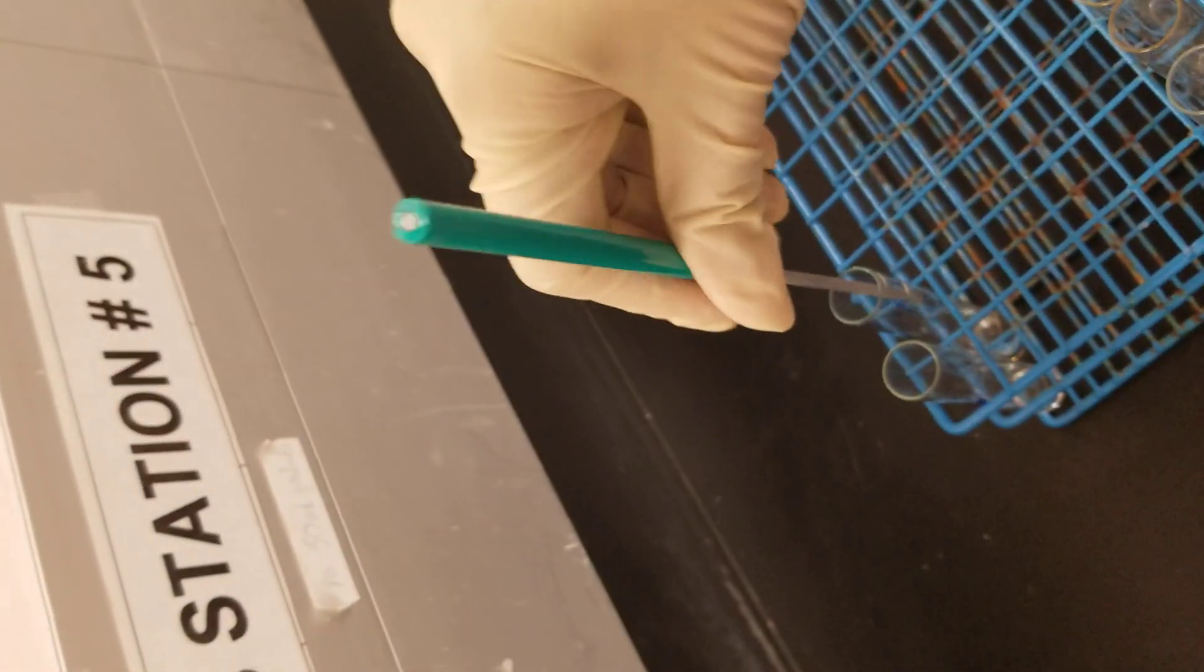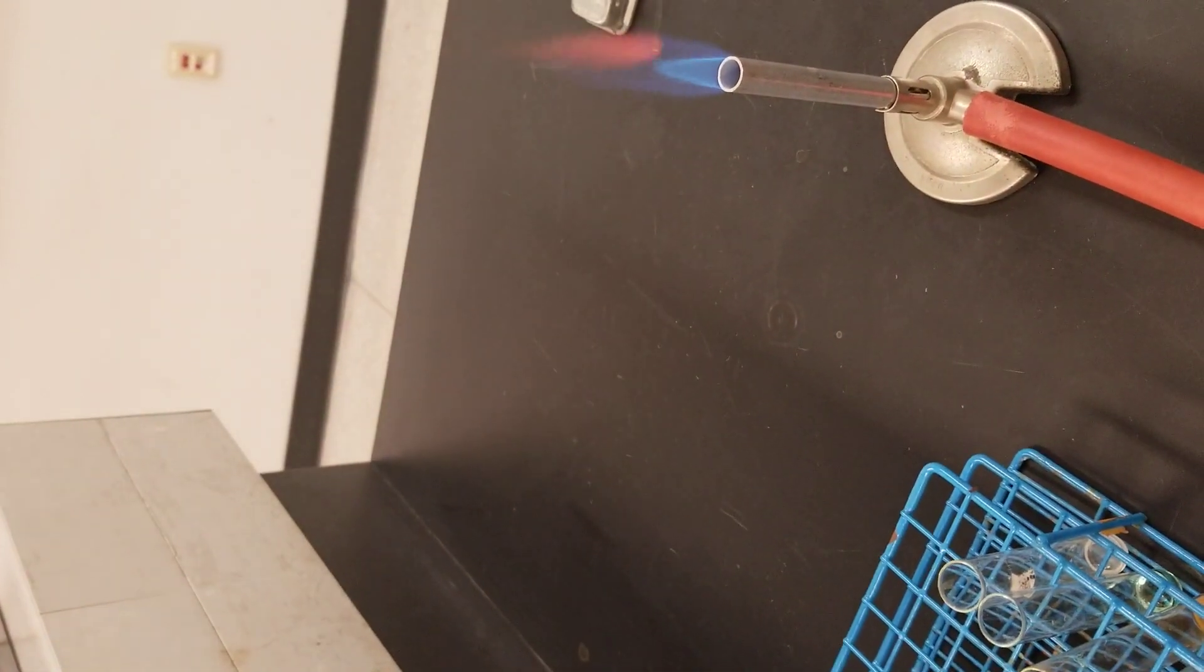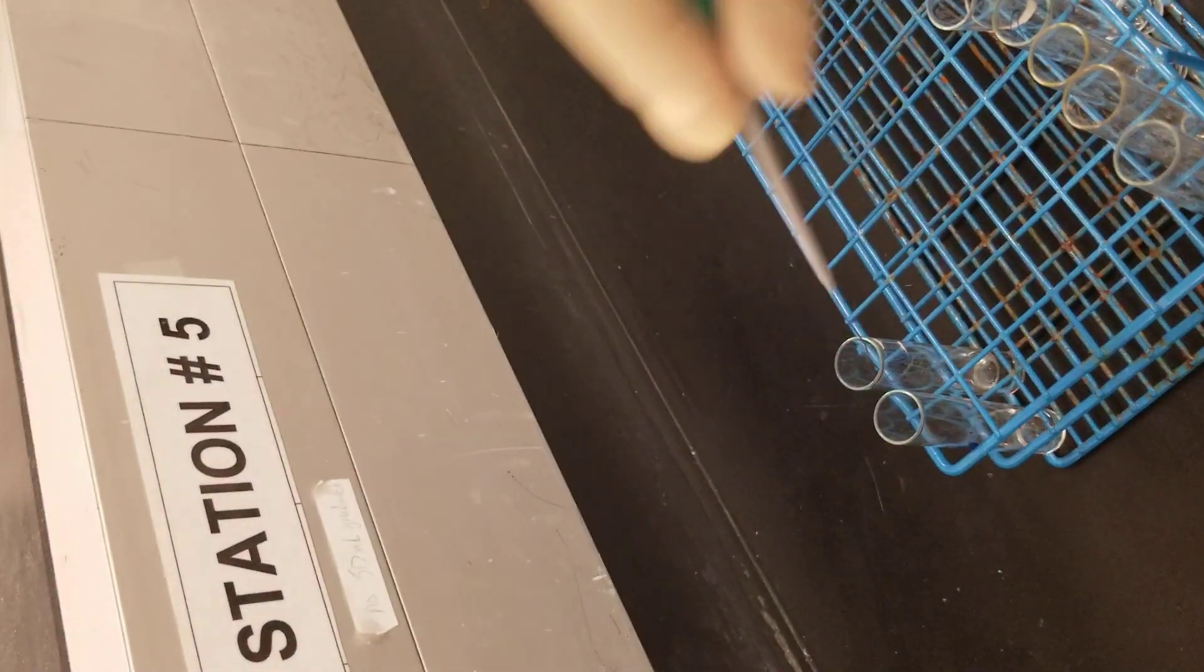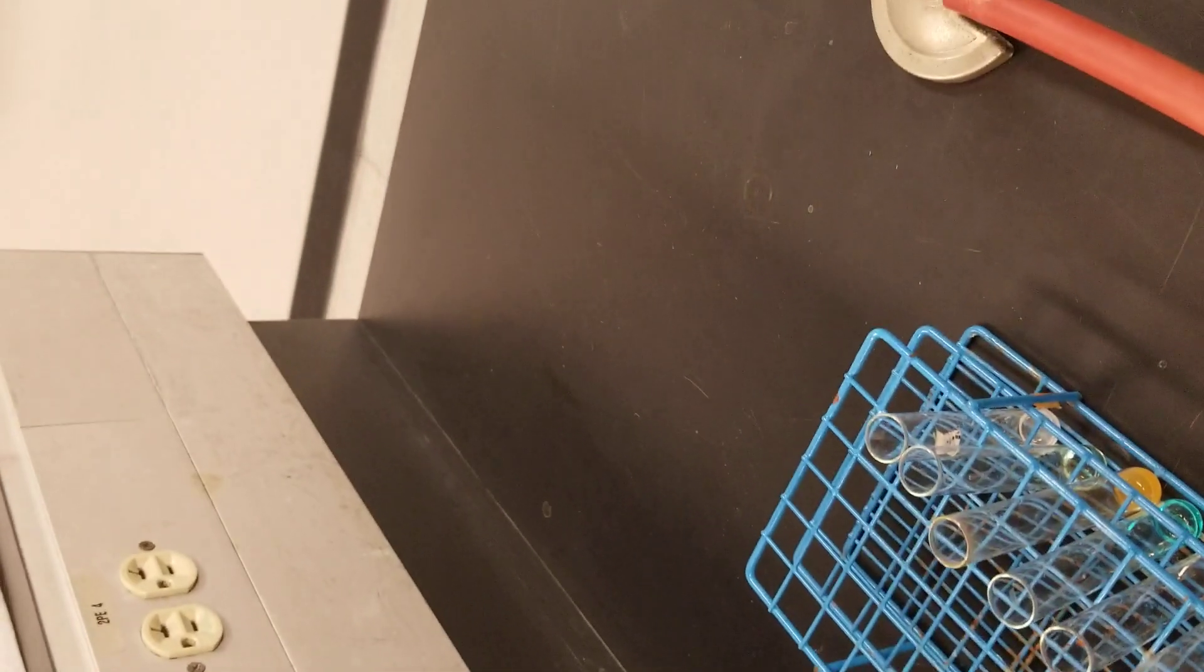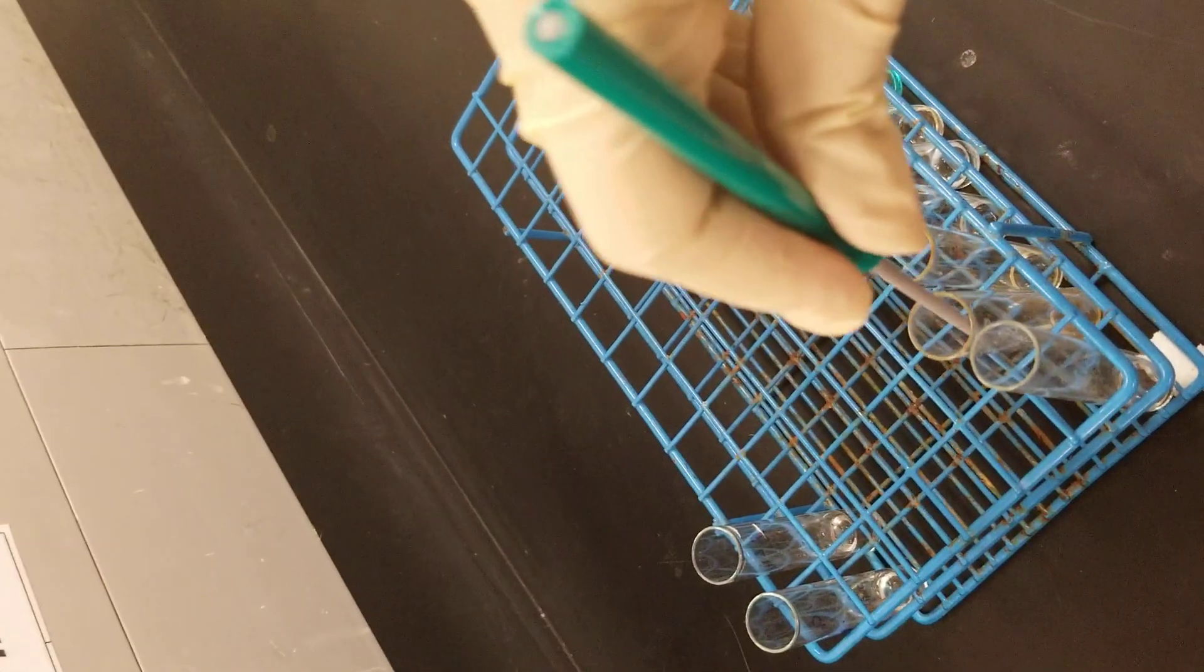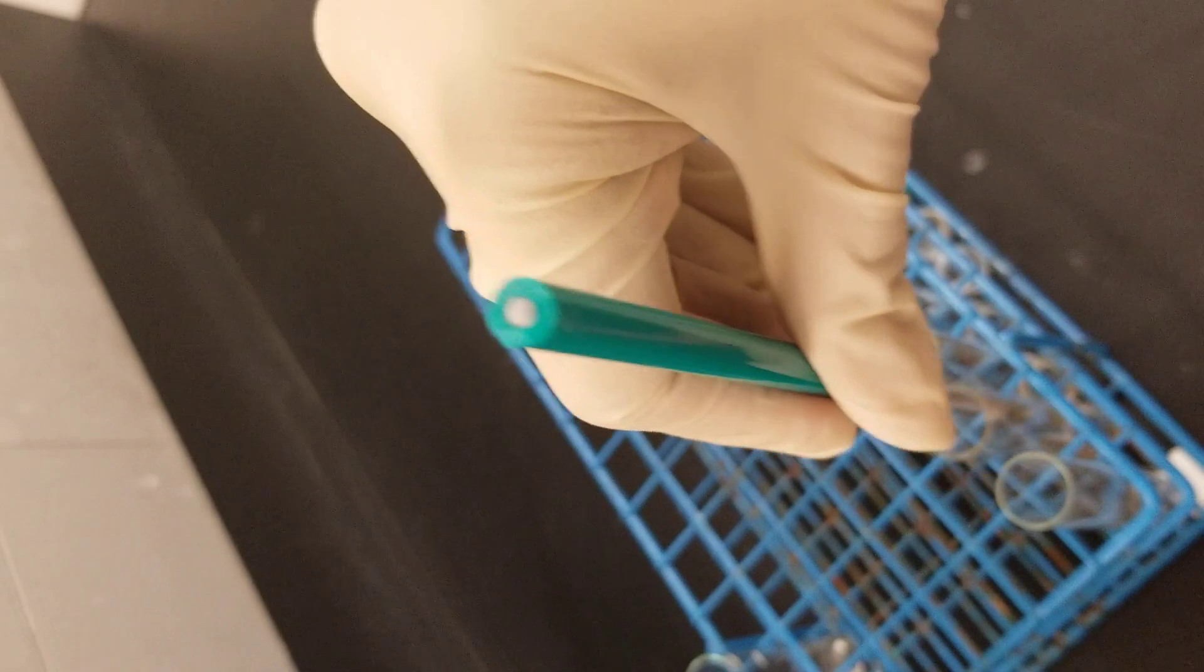After washing the flame test wire, I'm going to dip it into the second solution, which is sodium chloride.